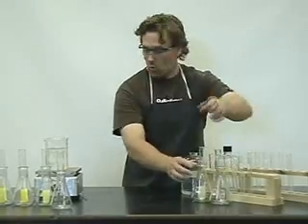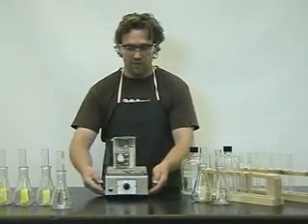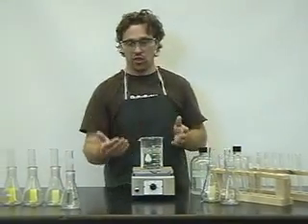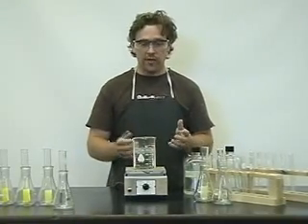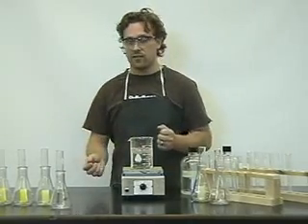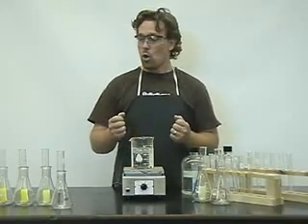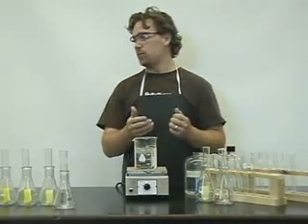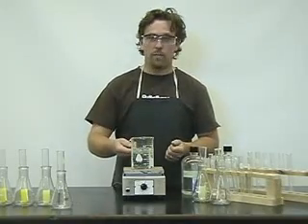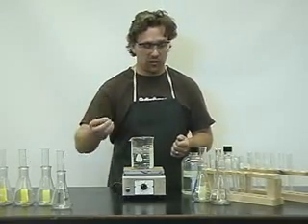In the second half of the lab, we graph and explore what happens to the Ksp as temperature rises — is there a relationship between the solubility product constant and the solubility of ions as temperature increases? We take the four test tubes where the solid has formed, place them into a water bath, and as the temperature increases, we observe when the precipitate disappears.